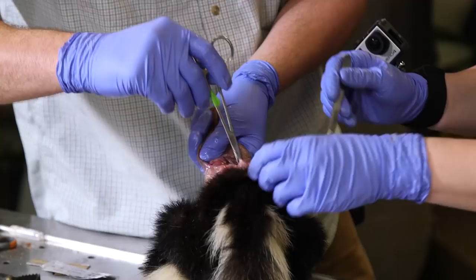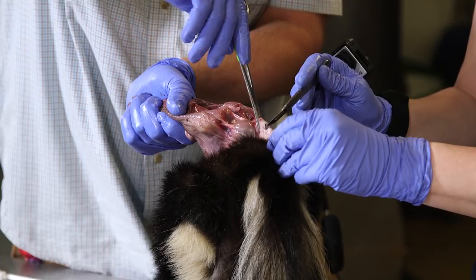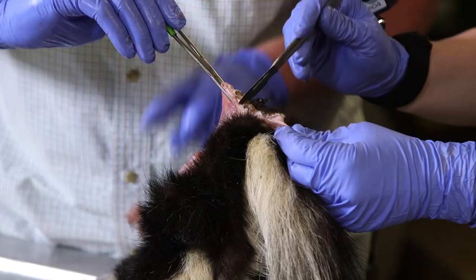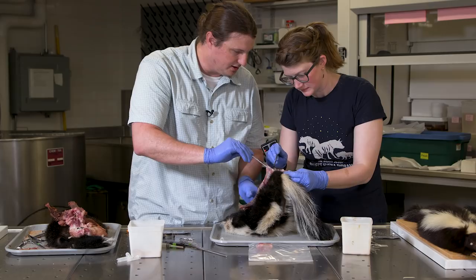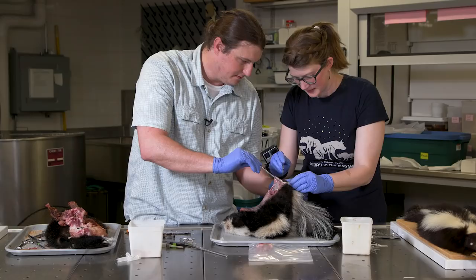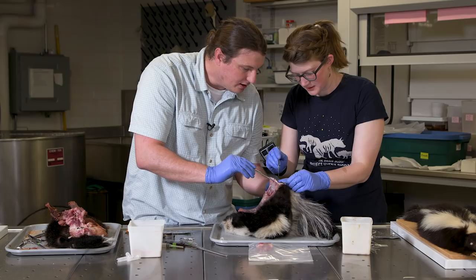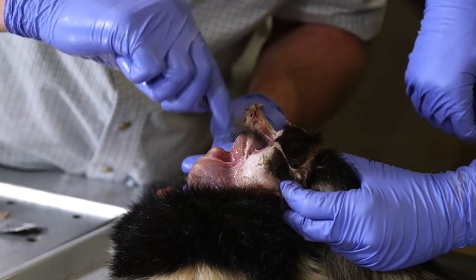Now very gently cut on that top side — just cut straight down, you'll see fur because you're actually cutting through the anus. Cut down at a 90-degree angle, very gently. I'm stressed. Sorry — I made a mess out of his back end. That's okay — the first one I did we had a giant hole like that; you just stitch it up and it's good.